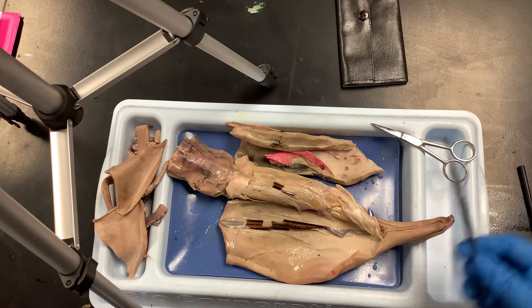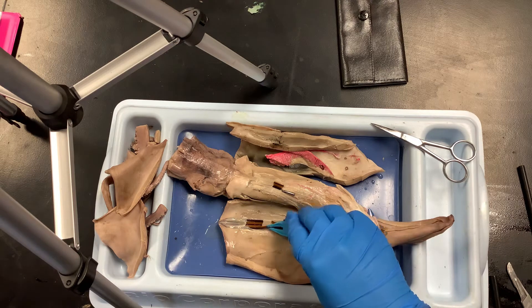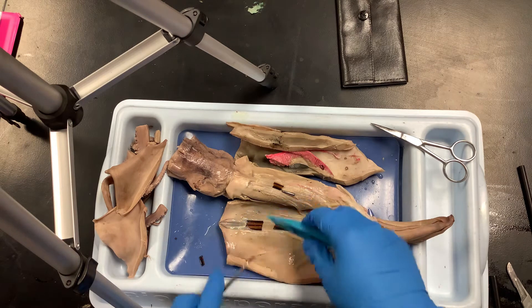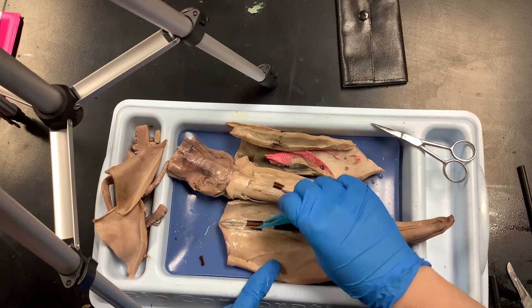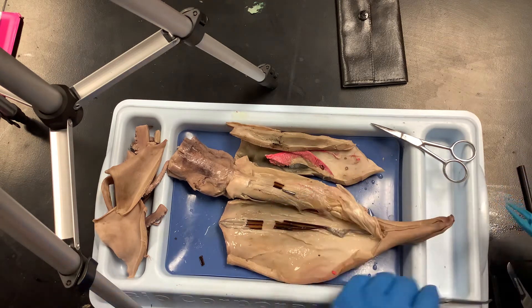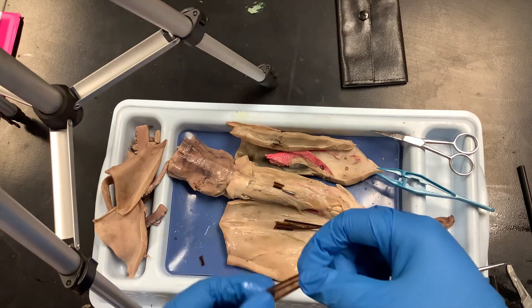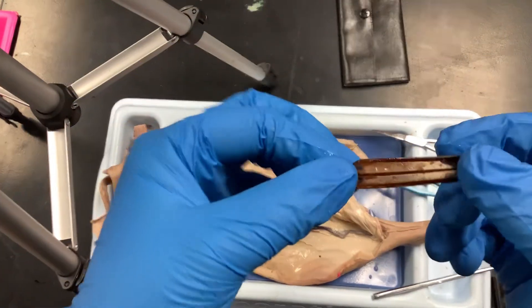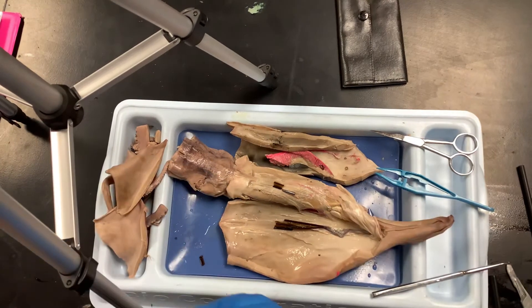I've exposed part of the internal shell, which we call the pen. If you want to come take a peek at mine — it should be one solid piece, but I broke it. This is the internal shell and it's very very delicate. It gives just a little bit of form to the squid. Here's a piece of the pen — it's kind of like a feather, very delicate. It extends all the way up to the tip of the lateral fin at the top.